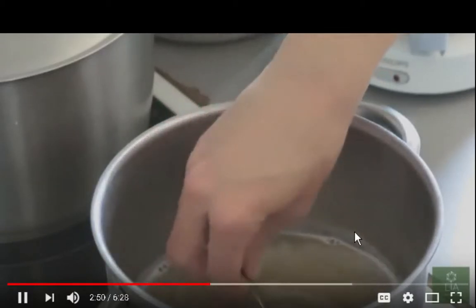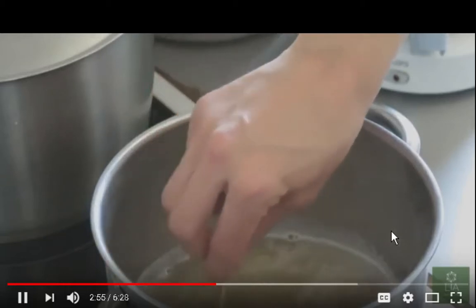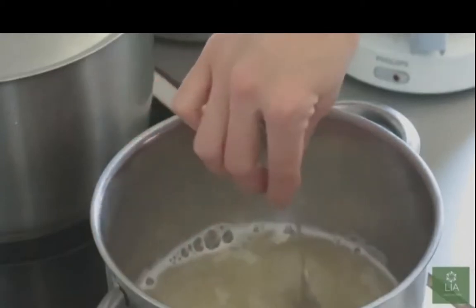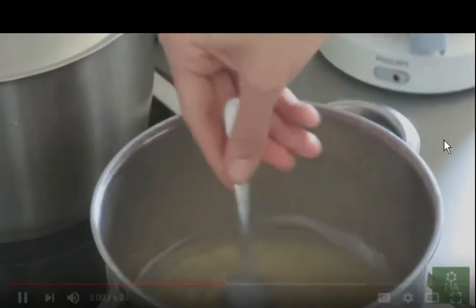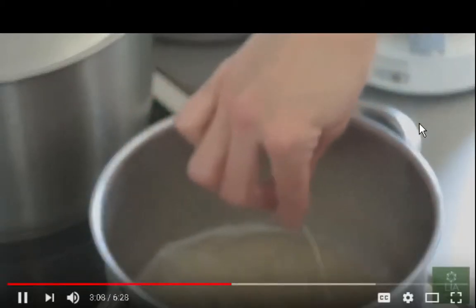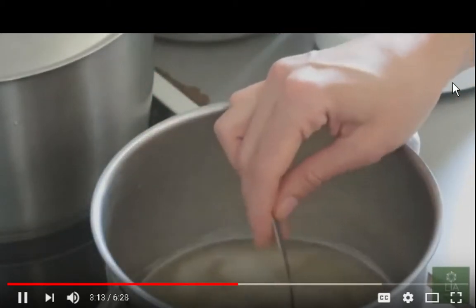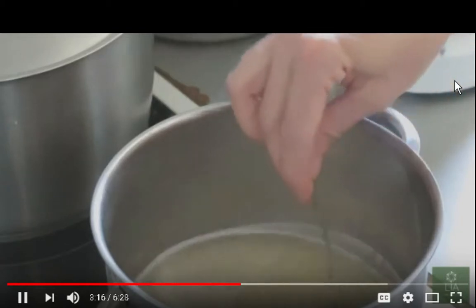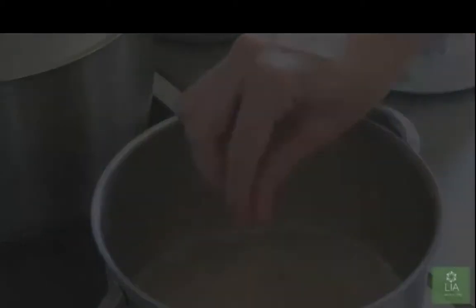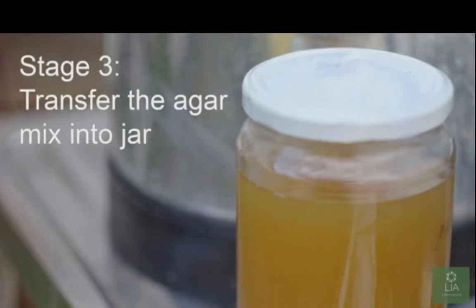I'm guessing they just add the brewer's yeast and the agar to distilled water. Transfer the agar mix into the jar.